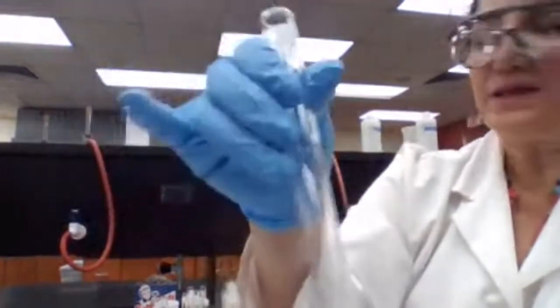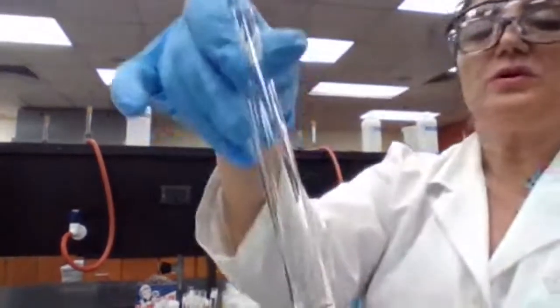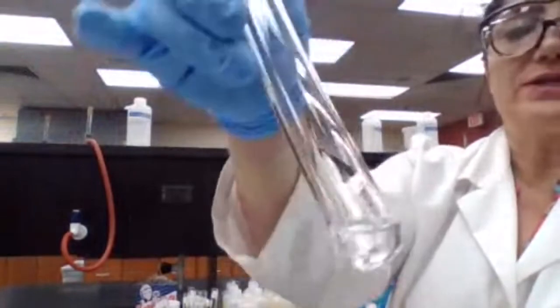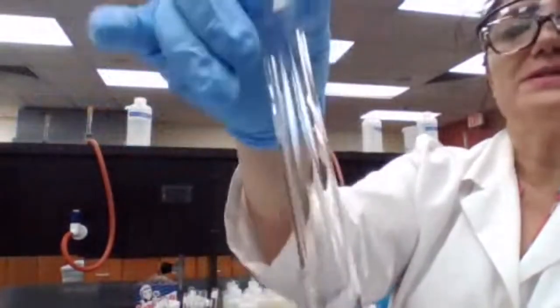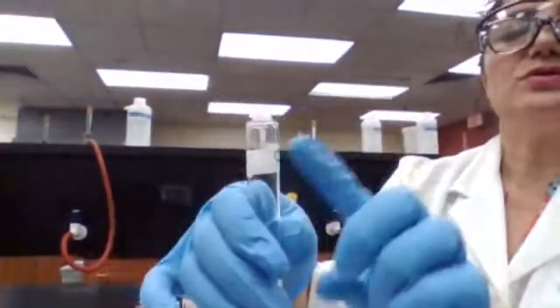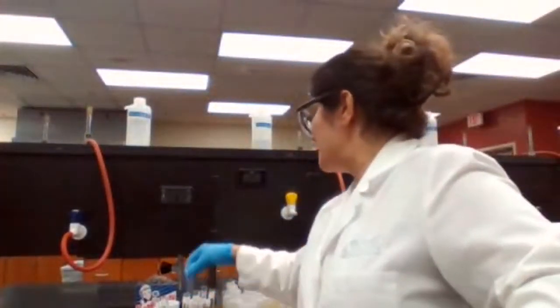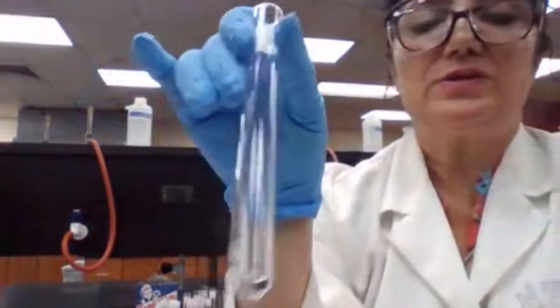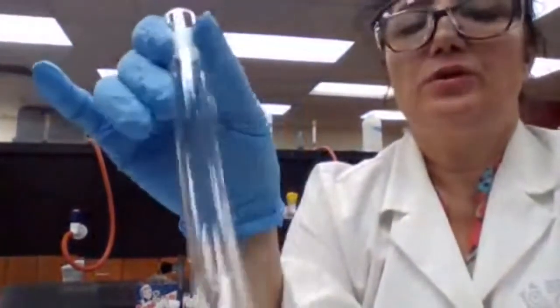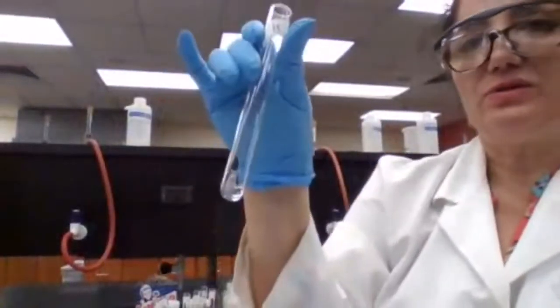For test tube G, magnesium with sodium chloride — clear solution, nothing happened, no particles came out, no reaction. For test tube H, magnesium with KCl — no reaction either. It's a clear solution and no particles came out. So for both G and H there is no reaction.